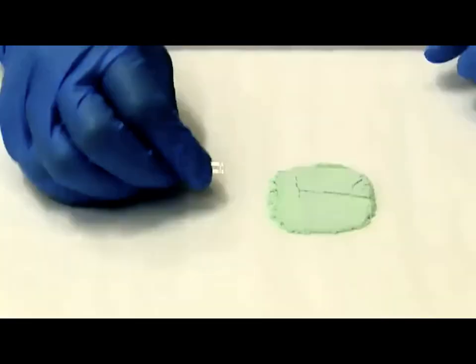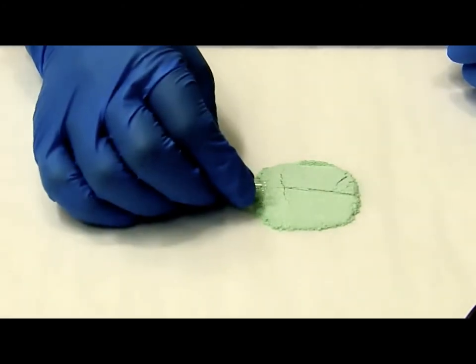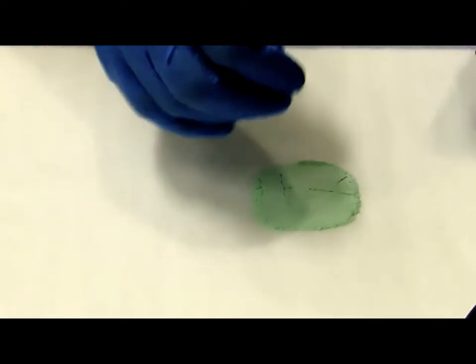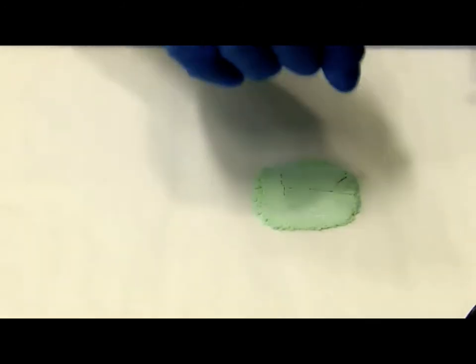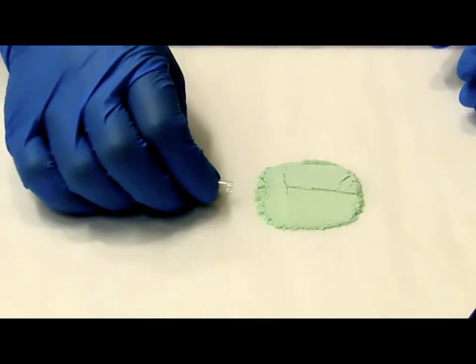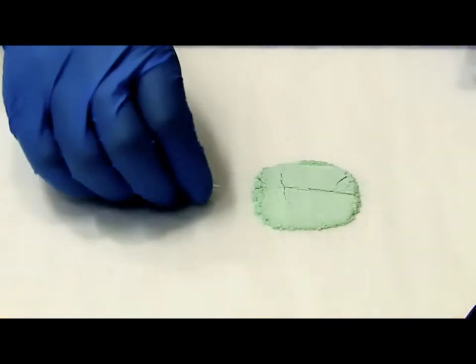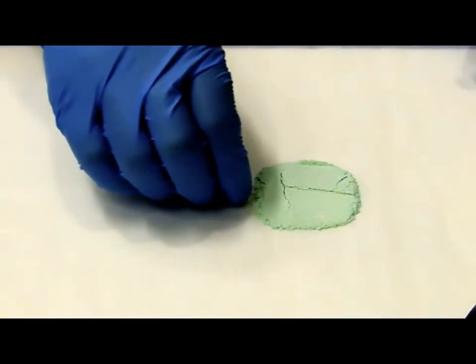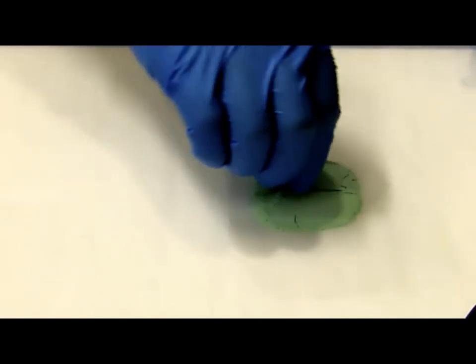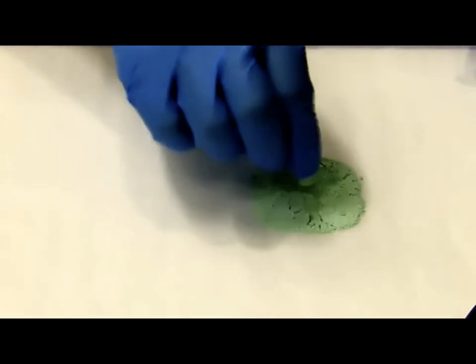And this is how you do the punch method. Basically, you're going to scoop from the side. And as soon as you're somewhere in the middle, you flip over and then do punch. I cannot really do this procedure in slow-mo, so let's walk through the process one more time. You scoop from the side and flip over and then do punch. All right, let's see how I do. You scoop from the side, go in. As soon as you're in the middle, you flip over and then you do punch.